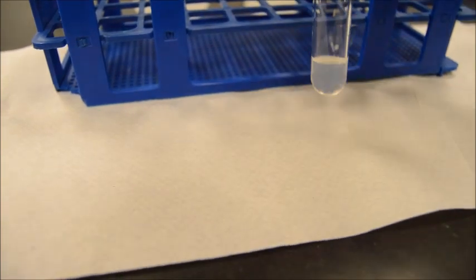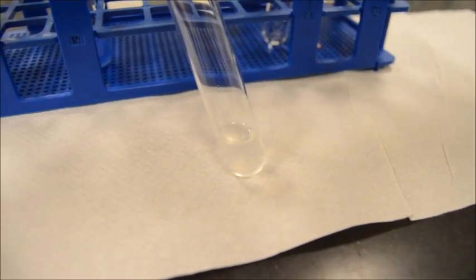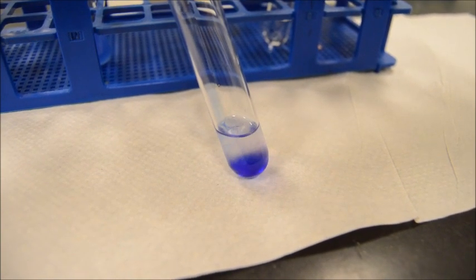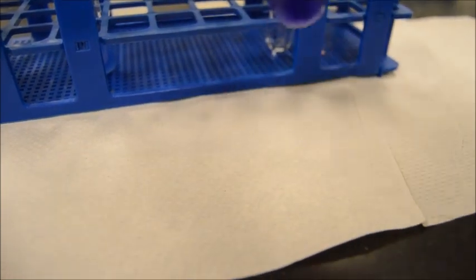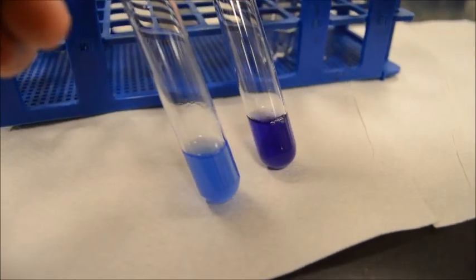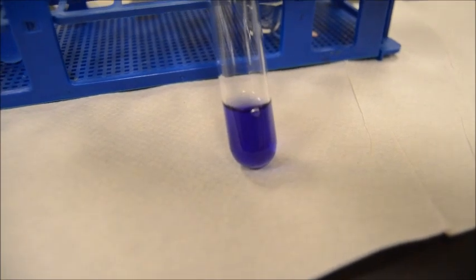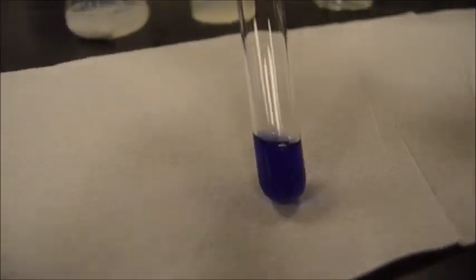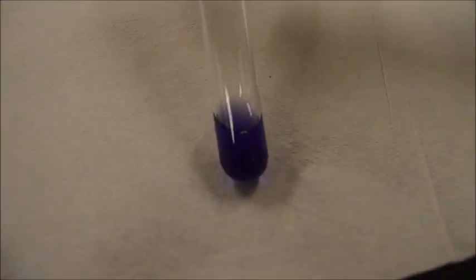Here's our albumin. Here come the reactions. It's going in, a little bit of shake to it. Now what I want you to notice is that we put the same stuff in these. But as I'm sitting here in person, that is purple. It looks kind of bluish, but probably because this is behind it. But I'm here to tell you, folks, that right there, that is purple. As purple as the day is long.